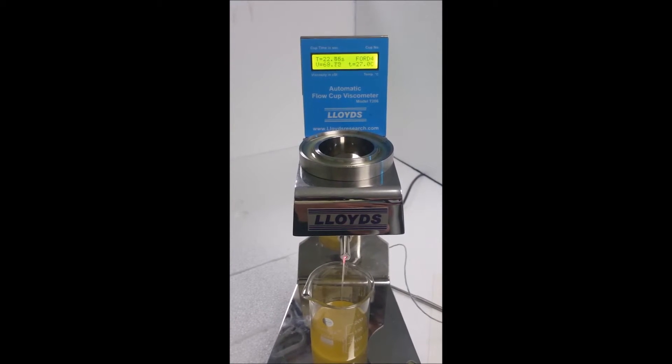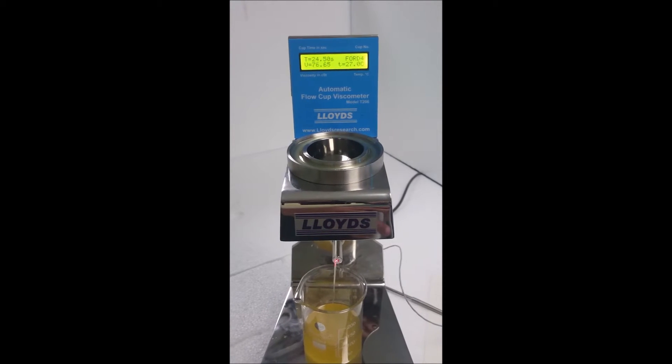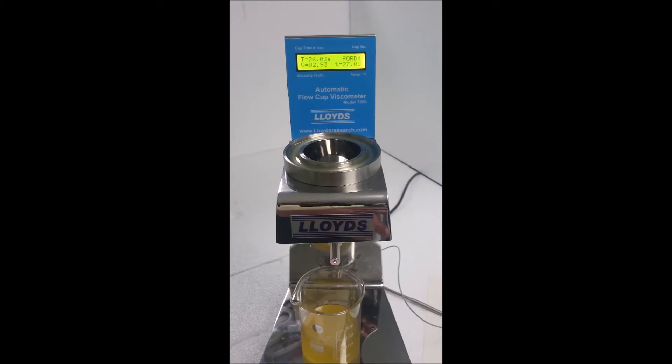At the first break in the flow it stops the timer automatically. The elapsed time represents the flow time of the test fluid.